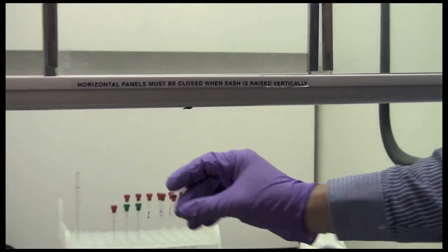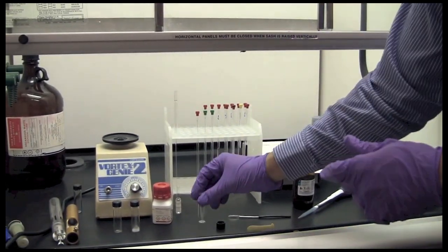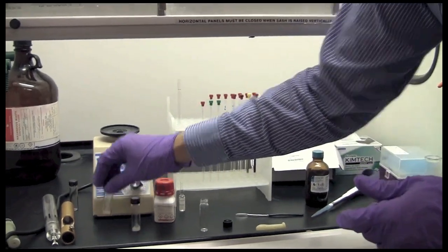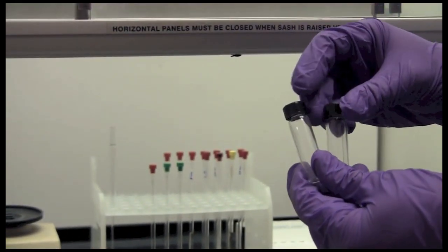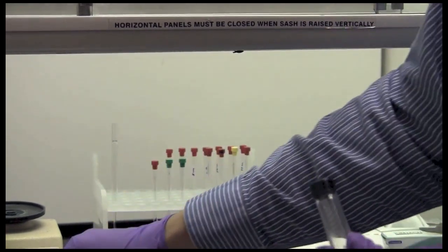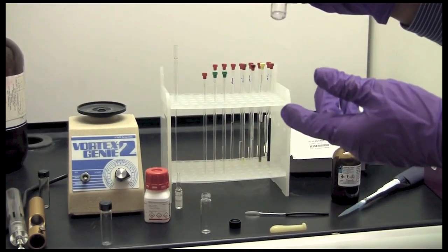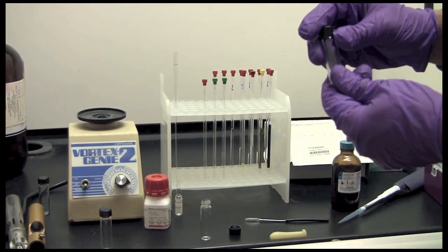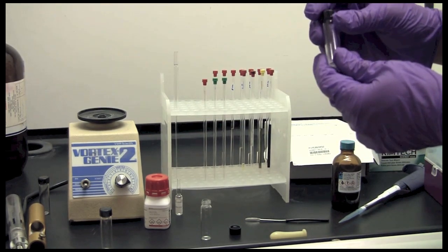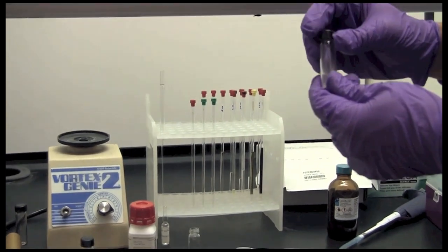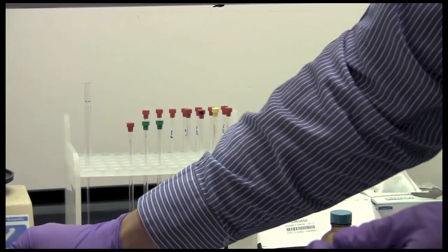To prepare your tube I recommend that you prepare your sample in a vial first and then transfer it into an NMR tube. The amount of material that you will need will range from about 1 to maybe 10 to 20mg for a proton spectrum and as much sample as you can get for a carbon sample without having precipitate. Having too little sample will greatly lengthen your experiments and may make it impossible to get data as NMR has very high resolution and information content but has very low sensitivity.